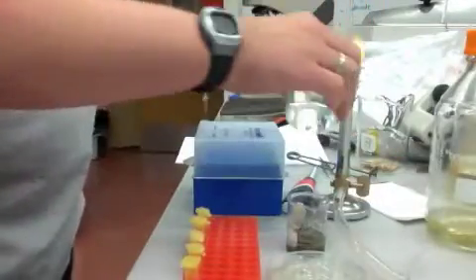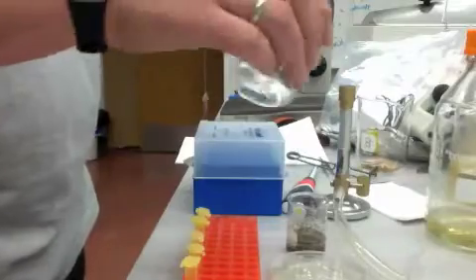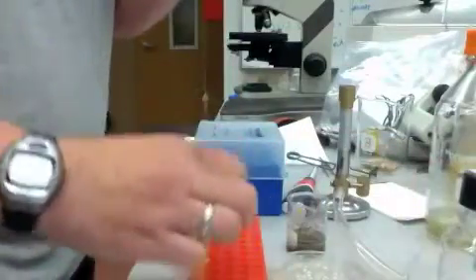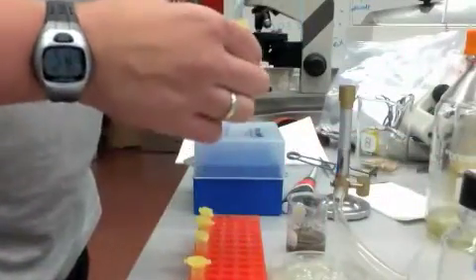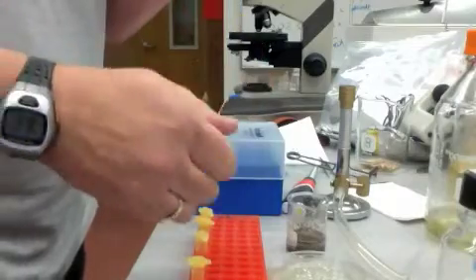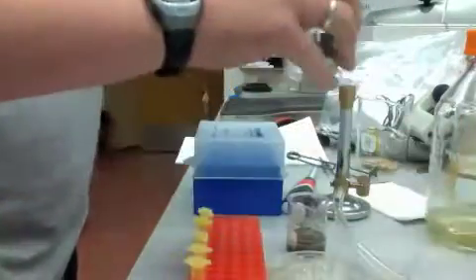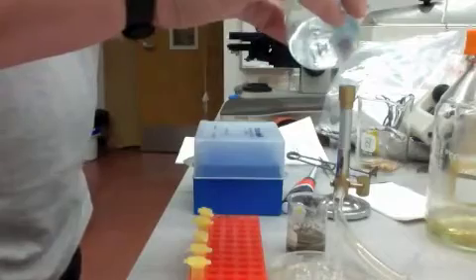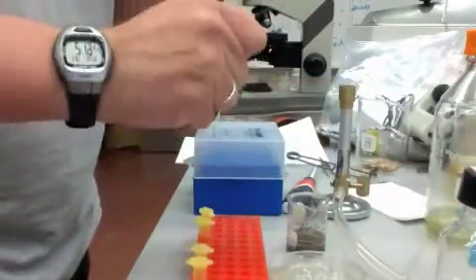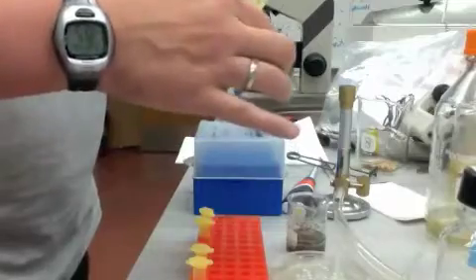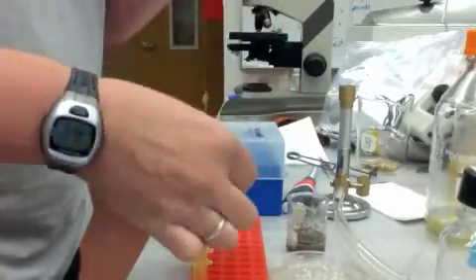And I'm just going to make 1 to 10 dilutions because that's the easiest for me to do. And that seems to be a good round number in terms of getting everything ready to go. Remember, you don't need huge volumes. But you just go through and you get your diluents ready to go.